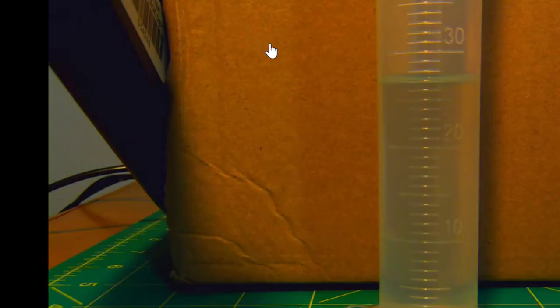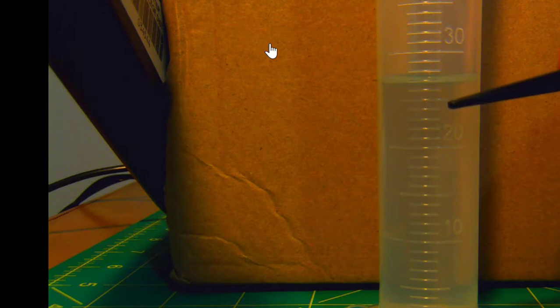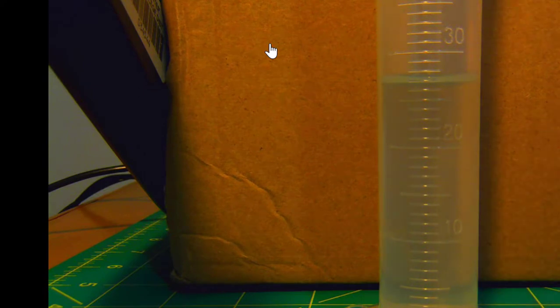Here we have the measure for the graduated cylinder. Again, we are not doing a 10 or a 100. This is a 50 milliliter graduated cylinder. We have a mark here for 20 milliliters. And then 1, 2, 3, 4, and then a mark for 5, 6, 7, 8, 9, and then a mark for 30. So be aware of the marks. Remember to guess the last digit. Remember to read from the bottom of the meniscus.